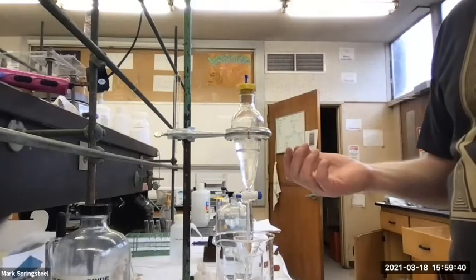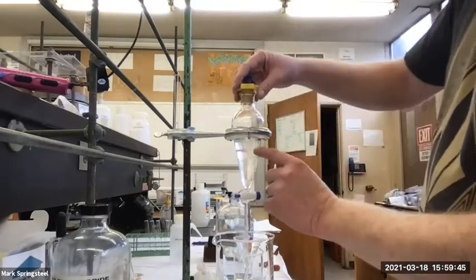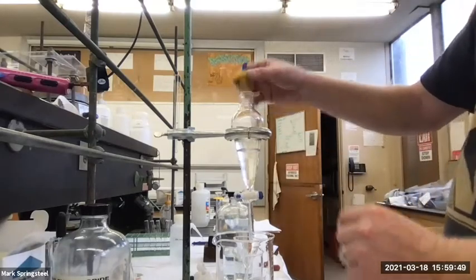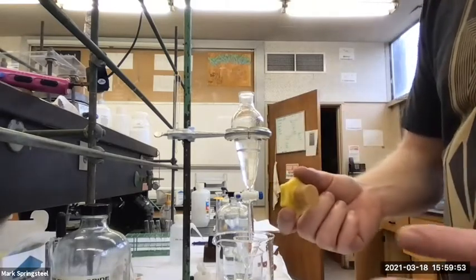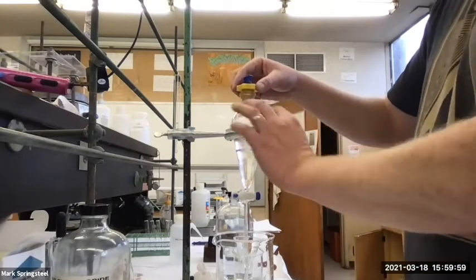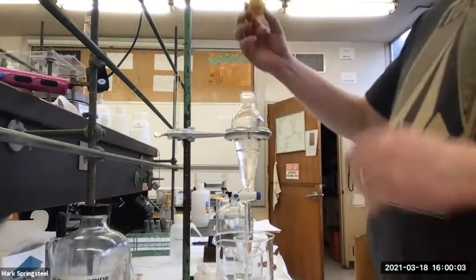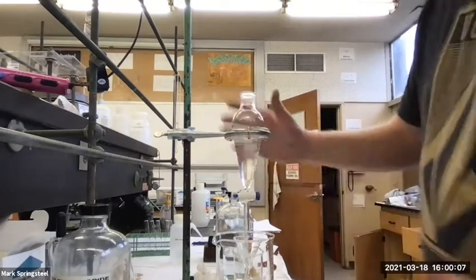It seems like you'd want to leave the cap on, but what happens is that a lot of times when the layers are separating, it builds up pressure and the cap will pop off. And if it's this plastic one, it's not such a big deal usually. But when it's the glass one, we've lost many of those where the student will leave it here and then after the pressure builds up, the glass thing falls and it breaks. So we don't want to do that. So you always want to take your cap off when it's resting. All right, and it's separating.